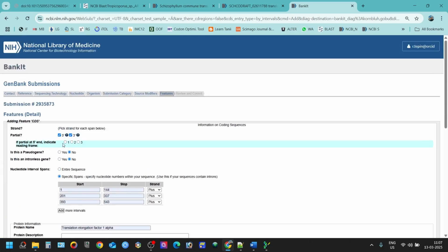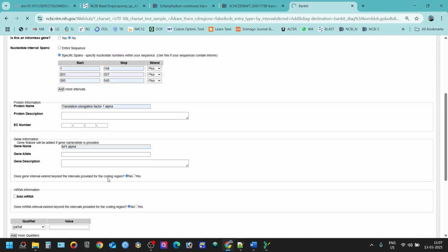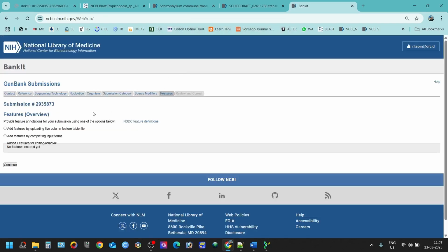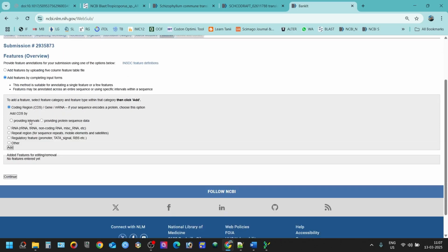Partial. Sometimes what happens is, for example, if I choose two, but if you choose one open reading frame, then you might find an error like this one. Okay, this one is also accepted. I will just remove it again and try the next open reading frame. It might not work in that case.